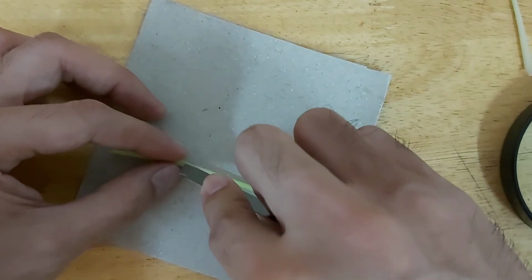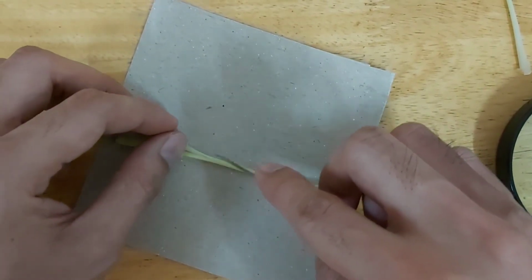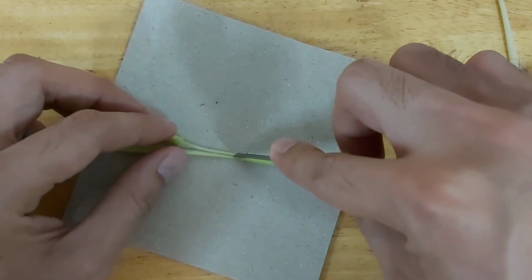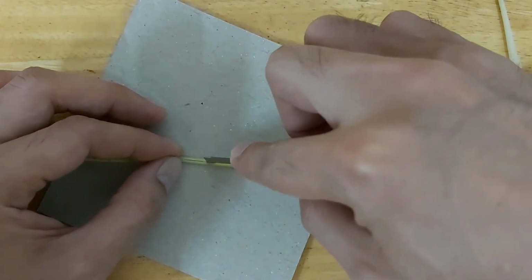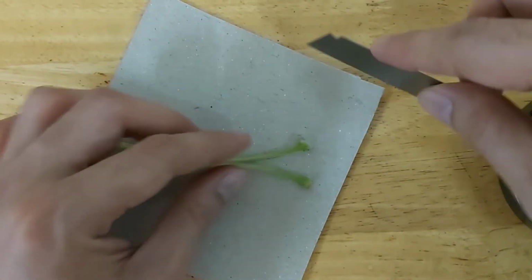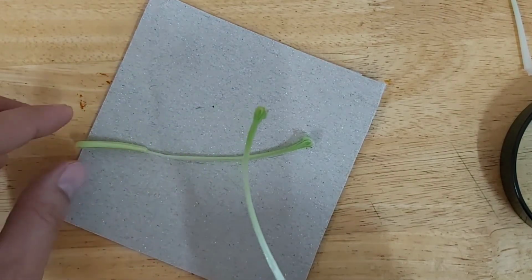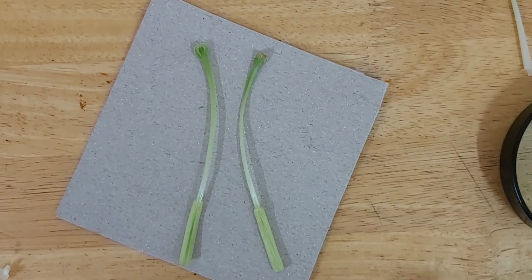It's kind of hard to cut. It's hard to cut the style evenly because it's not that big. So we're just going to cut it in half all the way to the stigma. Okay, nicely done. Now we have the pistils cut lengthwise, and then use a magnifying glass to look at the inside of it.